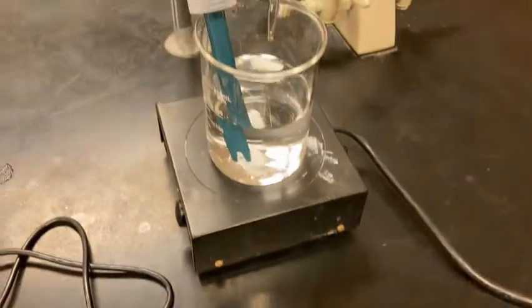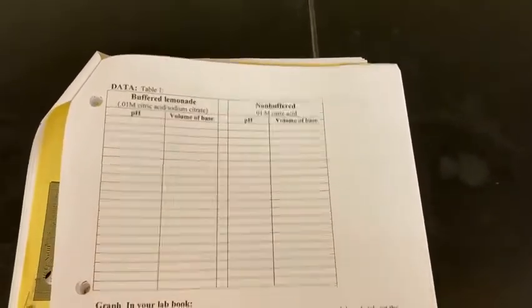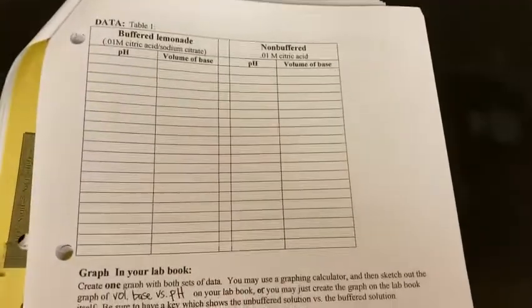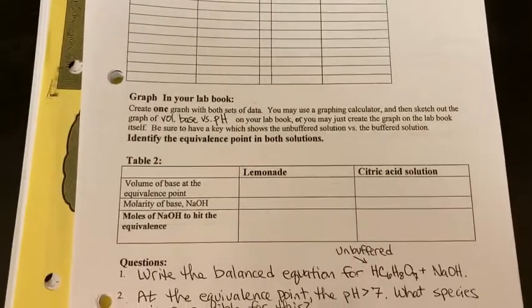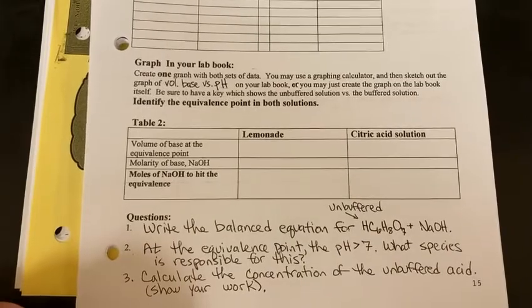All right. There you go. Citric acid titrated out. All right, finally, you have all the data for the non-buffered solution titration. What I'd like you to do is graph this data on the same graph you created for this data. So you get like a side-by-side comparison. You can use different colors for your titration graph lines to compare the two. And then you can go through and answer or do the calculations for table 2 and see what you can do with these questions. All right? Good luck. See you back in class.